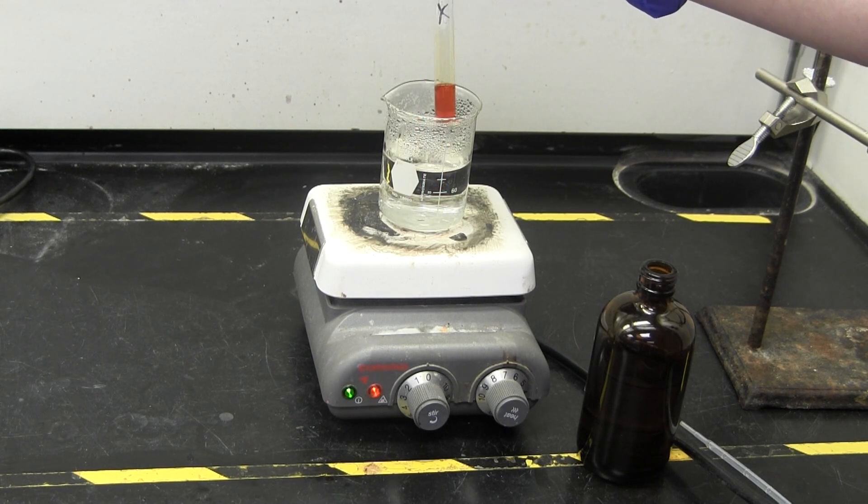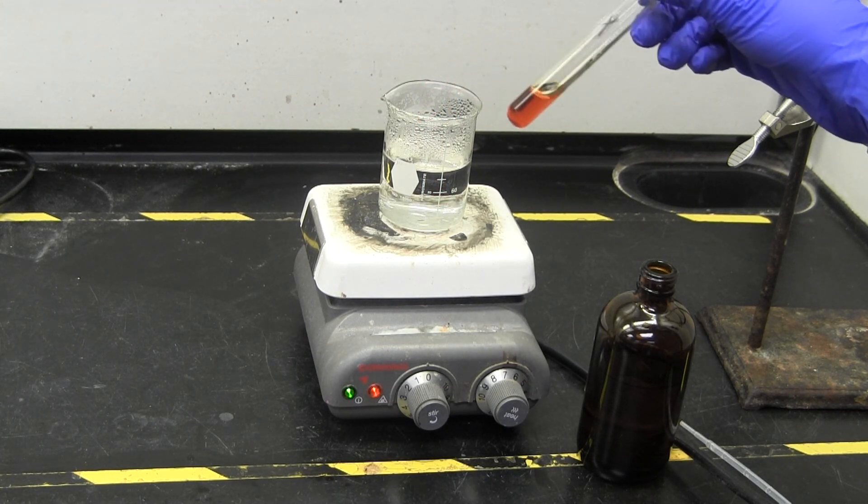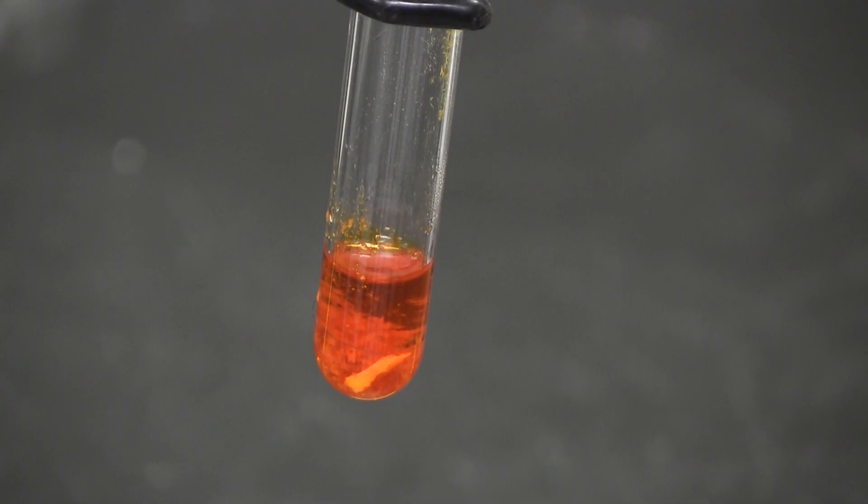Remove the mixture from heat and allow it to cool to room temperature. Be careful not to disturb the sample when it is cooling. You don't want to redissolve the crystals.